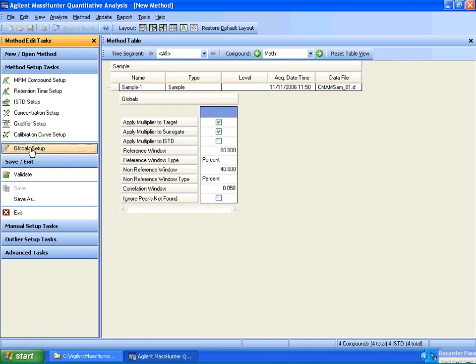So I'm going to go over to the method editor here and look into the global setup. Now the global setup are typically values that work by default. I'm going to change the ignore peaks not found setting. What that is going to do is filter out for samples a peak not found message in the quantitation message.